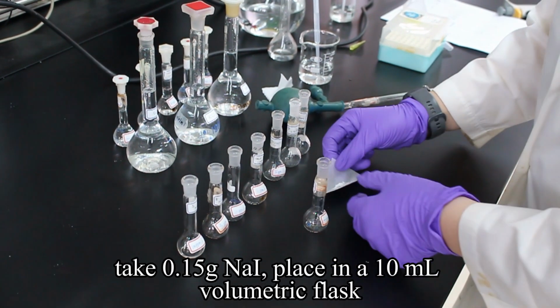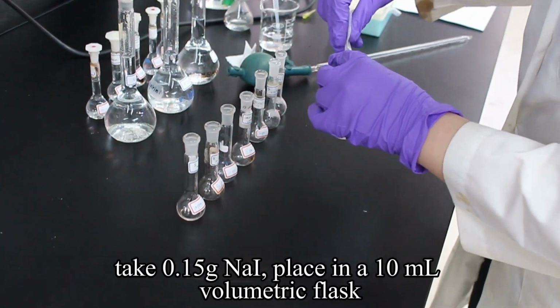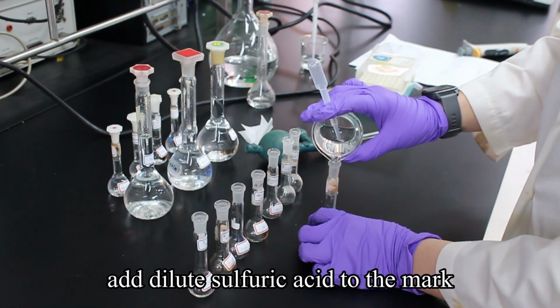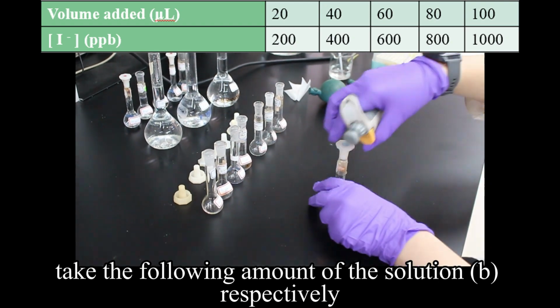Part B, prepare 10,000 ppm iodide solution. Take 0.15 g sodium iodide, place in a 10 ml volumetric flask. Add dilute sulfuric acid to the mark. Part C, iodide calibration line standard solutions. Take the following amount of solution B, respectively.